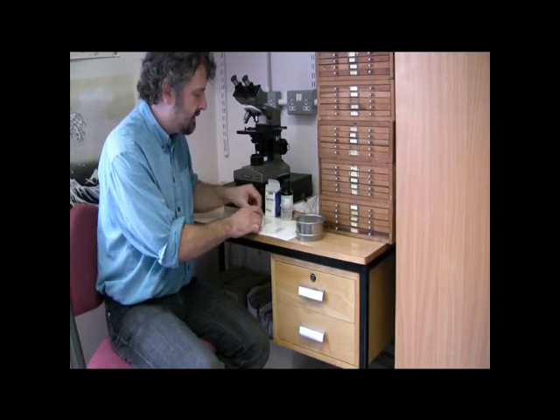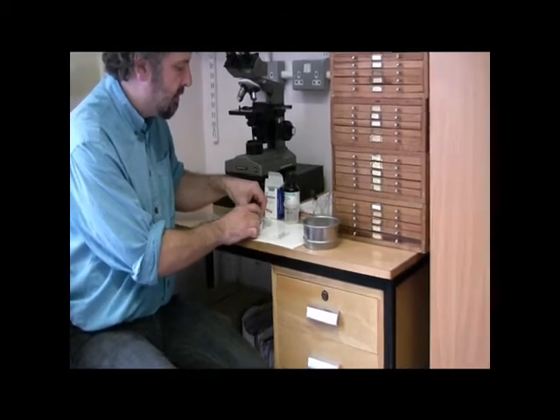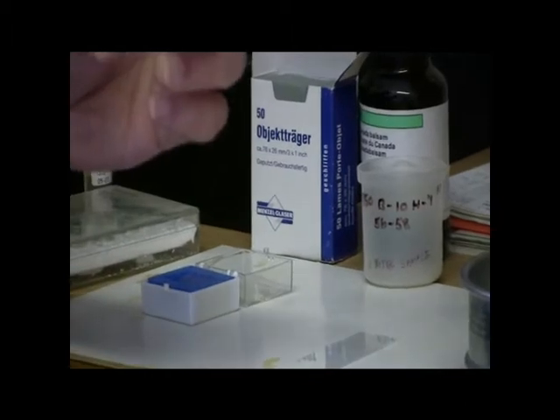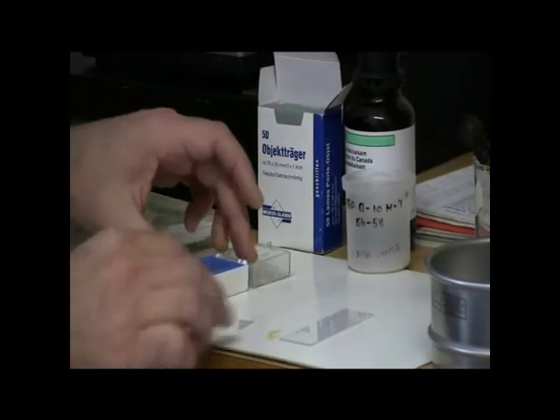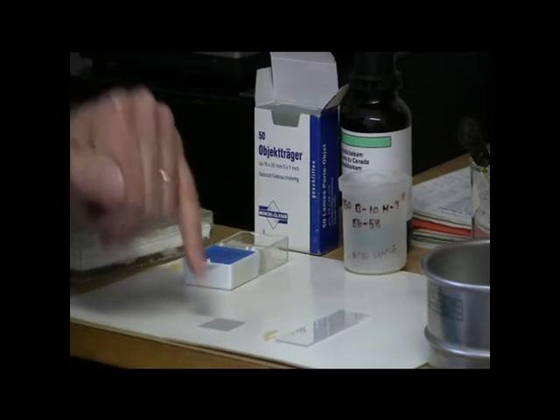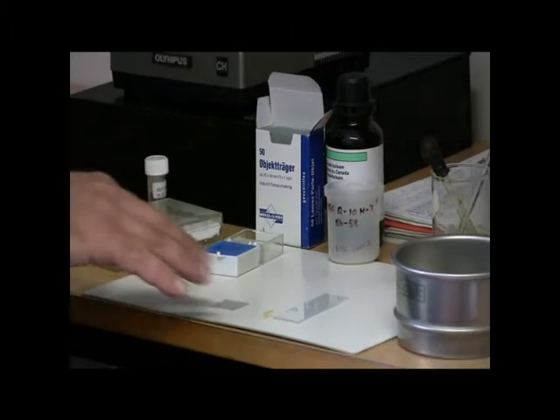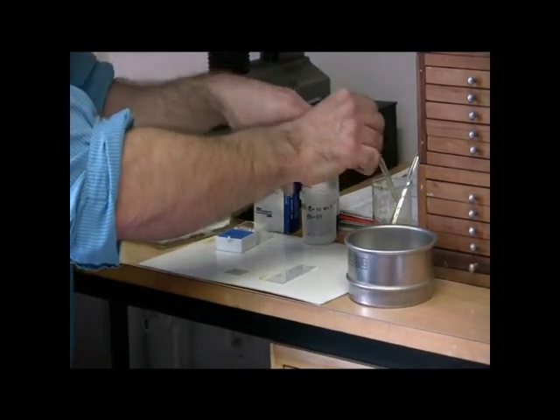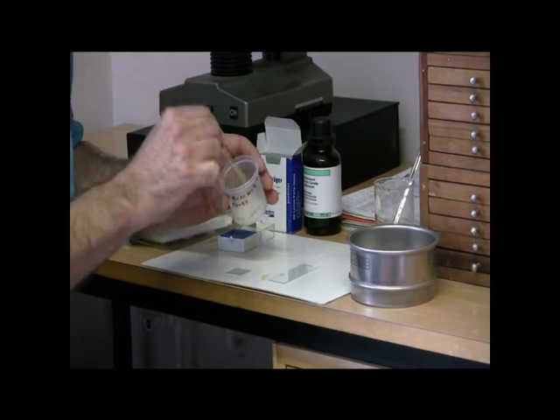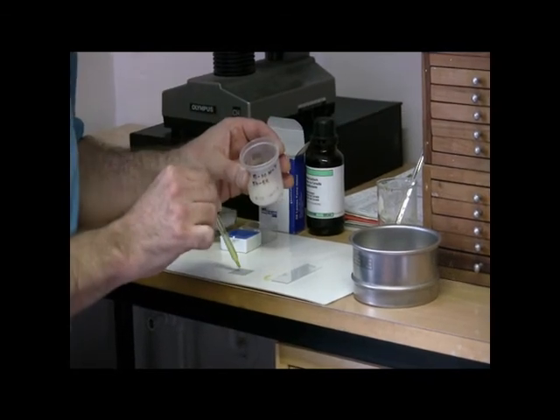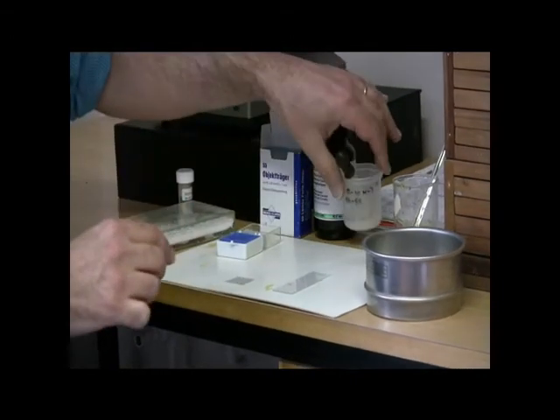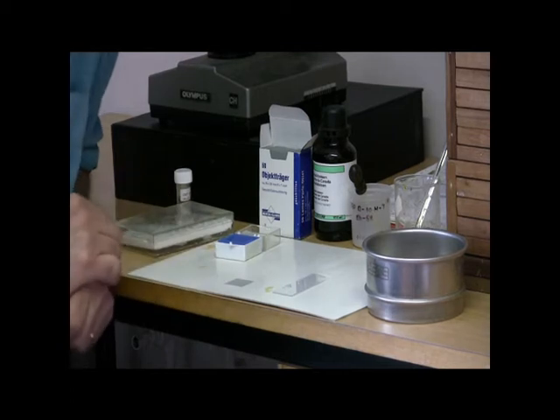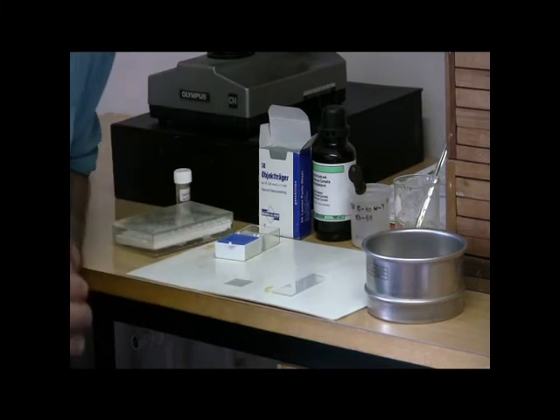Either use a firm surface or a hot plate in which to do this. There's a microscope slide, and in order to mount the material, the sediment, we need to have a glass cover slip. The glass cover slip is what we actually put the material onto. We would have perhaps a line of these glass cover slips, and of the material, we would take a pipette and take out some of the material and drop it onto the cover slip. You should put enough material on there that it covers the entire cover slip, and then you simply leave that to dry.